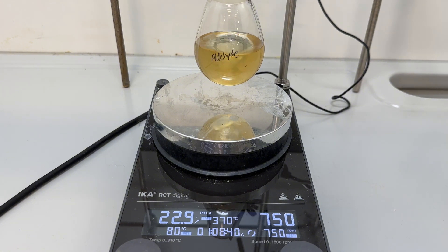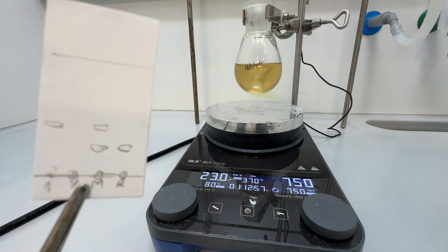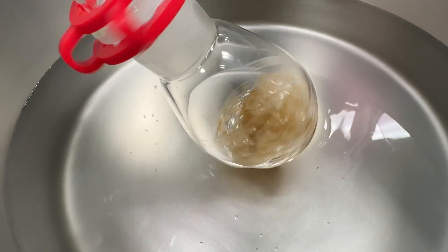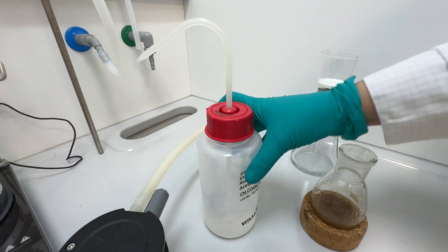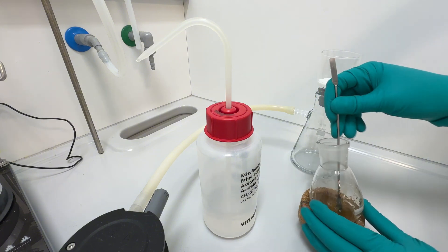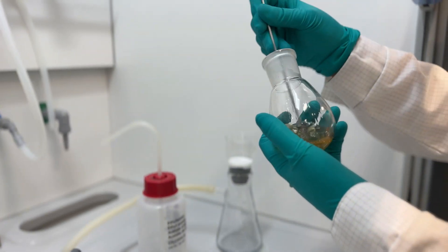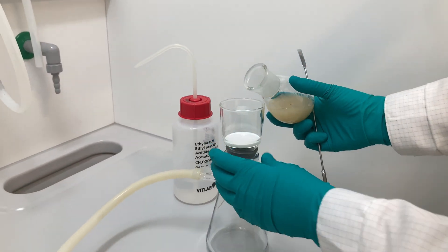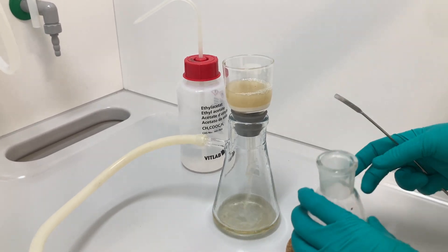After cleaning up the mess, we allowed the reaction mixture to stir for one hour at room temperature. TLC analysis indicated full consumption of the starting material, and the solvent was removed under vacuum. The resulting crude residue was triturated with ethyl acetate using a spatula until a white powder of triphenylphosphine oxide precipitated. The powder was filtered out using a Schott funnel, and the crude residue, obtained after evaporation of the solvent, was then purified by flash column chromatography. While it was not possible to get rid of all triphenylphosphine oxide by trituration, this additional step greatly facilitated the subsequent purification by flash column chromatography.